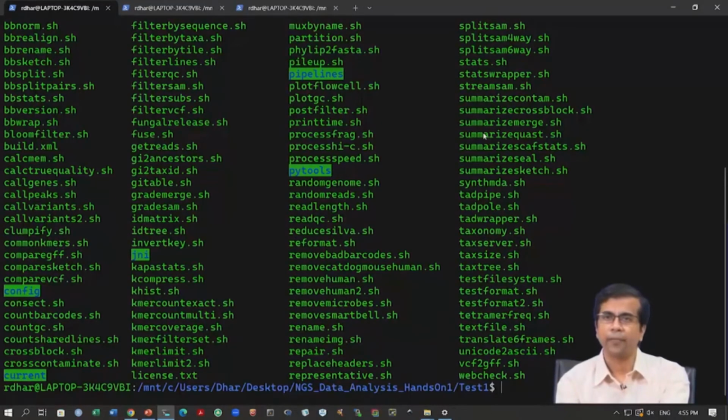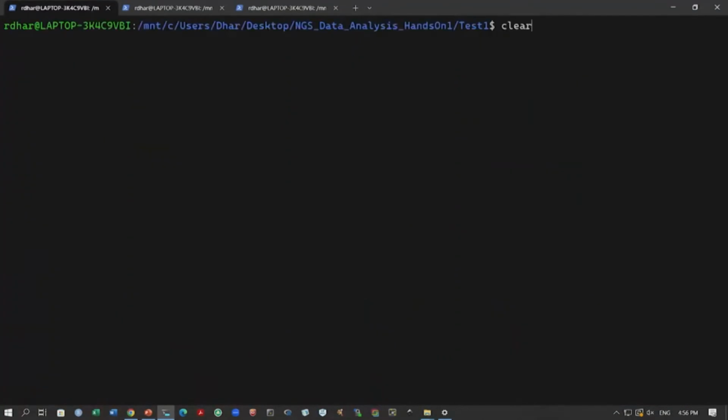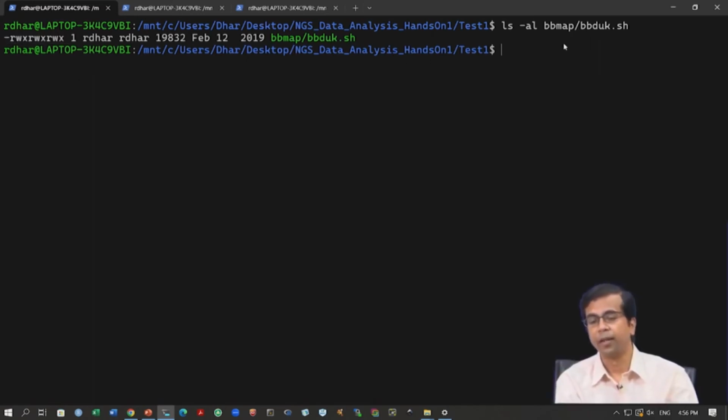Okay. So, let us look at those functions. You have a lot of functions, and as you have seen, BBmap can do a lot of things, but we are interested in only one function, which is bbduk.sh. Let us check if this function is there. We can also check if this has permission for execution. Sometimes when we download, there is no execution permission, but in this case we have. If you do not have this execution permission, you can change the permission using chmod. So, here is the function that we will use.